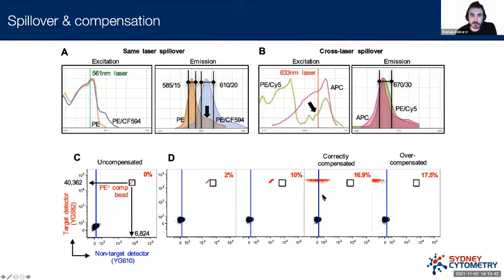Importantly, there's a factor here which we haven't addressed specifically yet. If we look at this correctly compensated data here, we can see that this isn't actually as straightforward as I'm making it out to be. This red population is spread out compared to the negative control down here. So it looks corrected in that it's no longer appearing in the non-target detector, but something's still not right. This is correctly compensated, but what we're observing here is a phenomenon we call spreading error. And we'll come to that in just a second, in the next couple of slides.